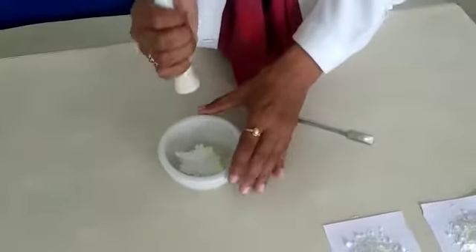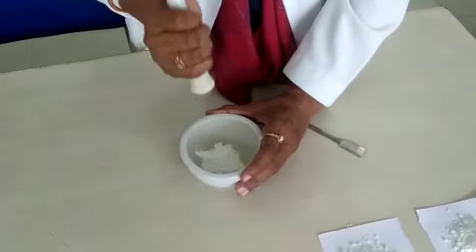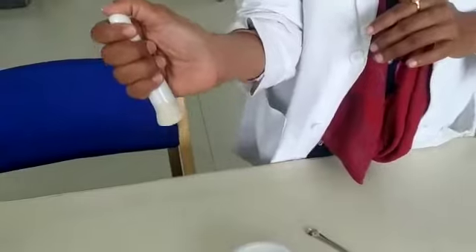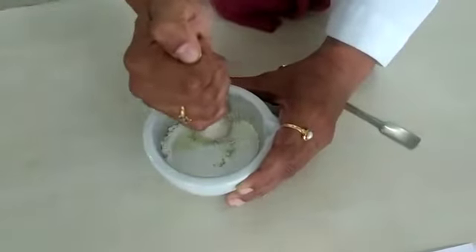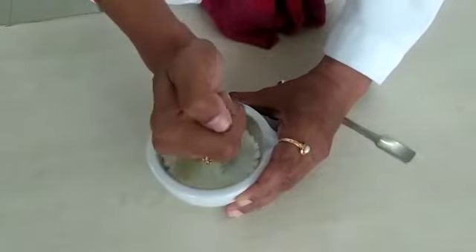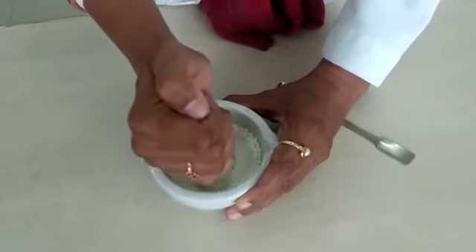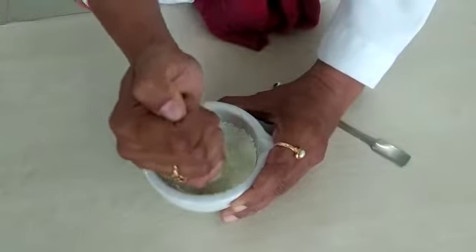For the first 6 minutes you are going to grind the drug substance. When grinding, hold the mortar with one hand and the pestle with the other — your thumb should be on the top of the pestle and the remaining fingers should encircle the handle. Make sure the mortar does not move. The movement should be only at the level of the wrist; you are not going to move your whole hand. The direction is normally anti-clockwise.